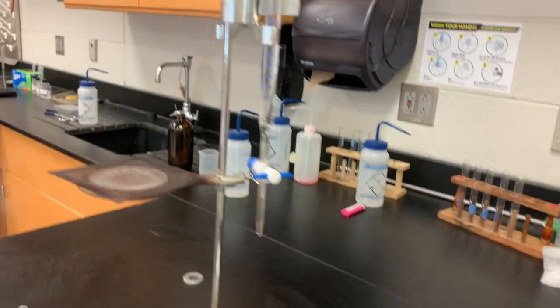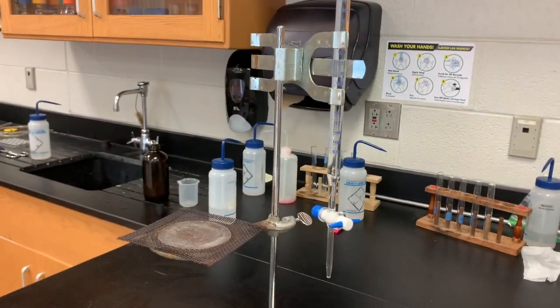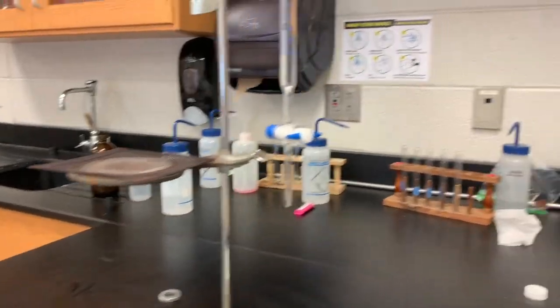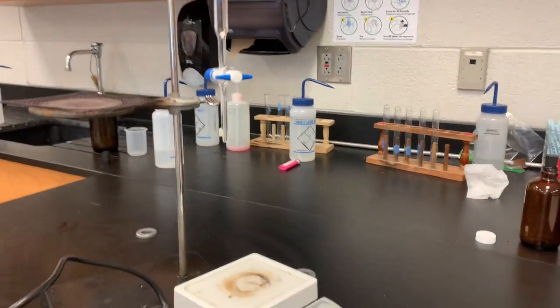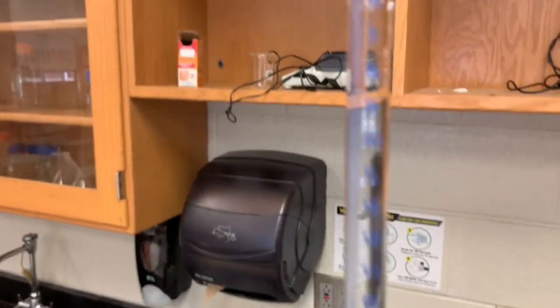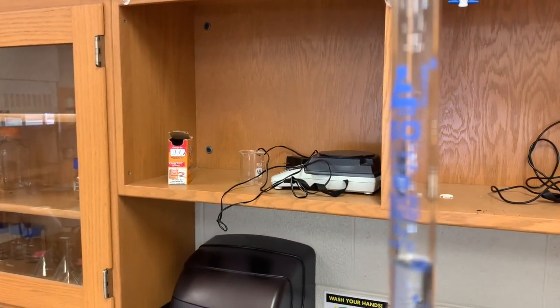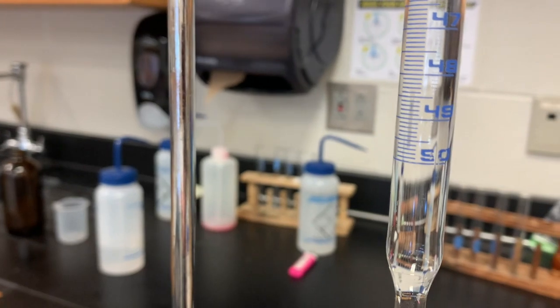The first couple steps involve cleaning and setting up your burette, which you can see here. This is our burette — it is a very precise piece of equipment used to measure volumes of liquids. I'm going to do this lab for trial one and then just give you the data for trial two, because it's very hard to set this lab up by myself. The meniscus of our sample is right at zero — a little below zero — but we're going to say we have a full 50 mL here, which is how much is in the burette when it is full, and it is full currently.